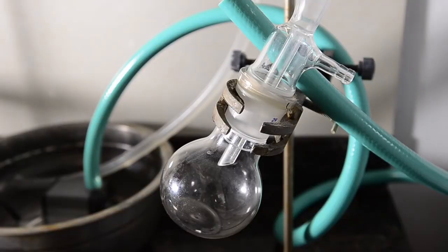You could possibly use a simple distillation on a strong heat source such as an oil bath but you'd need to go very slowly and carefully.